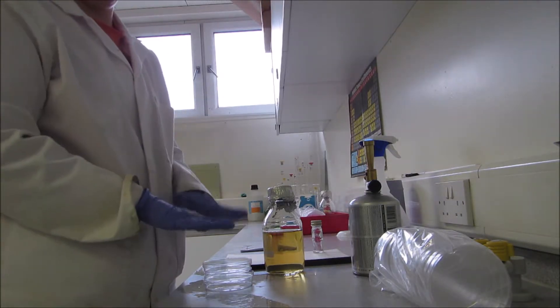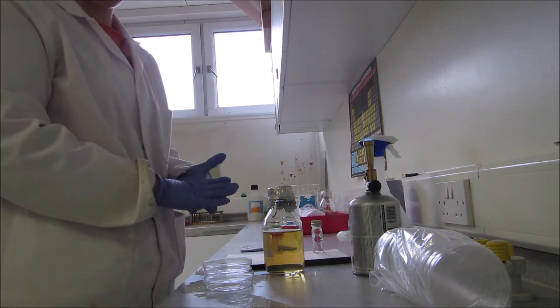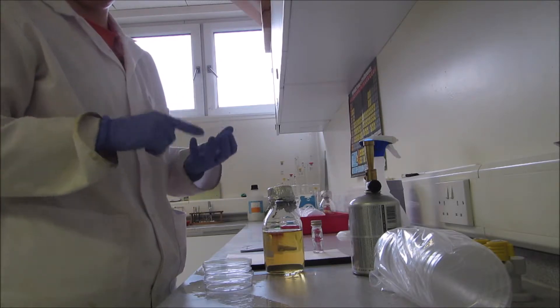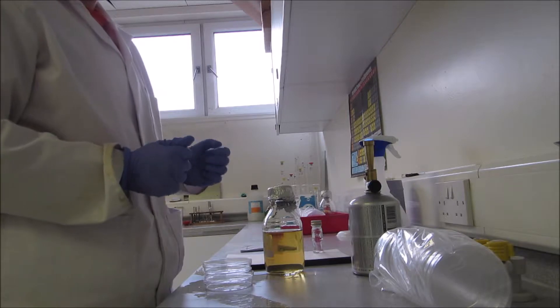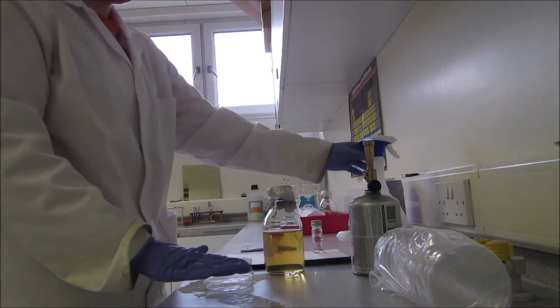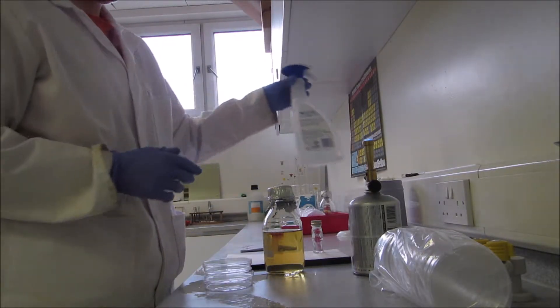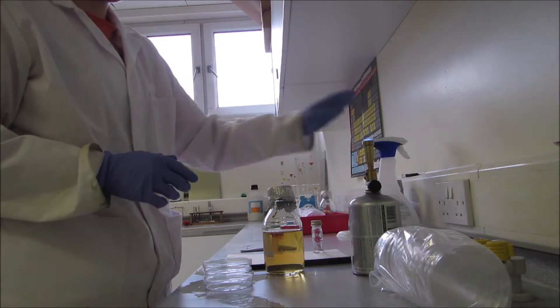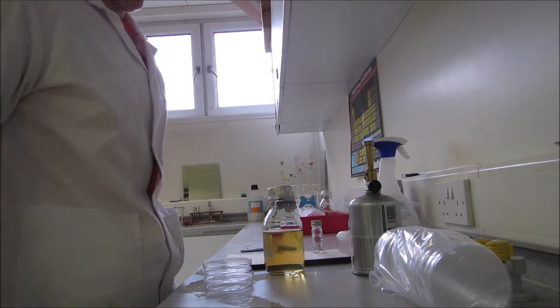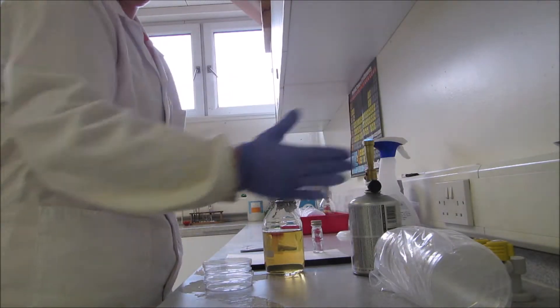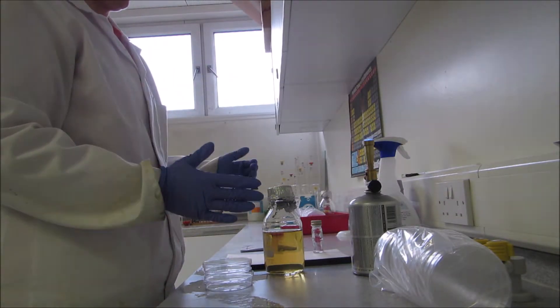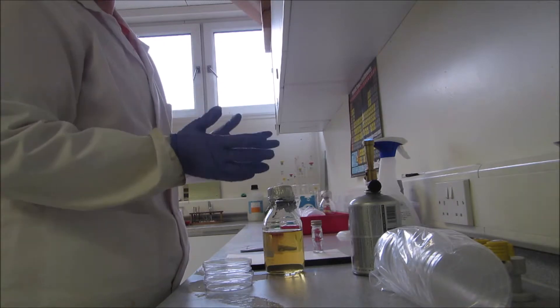When working with microorganisms or with agar, you don't want to contaminate it with anything from the environment or your own body, so you work using aseptic technique. Before I started the video, I wiped down the bench with an antimicrobial spray and placed everything I need within a working zone.